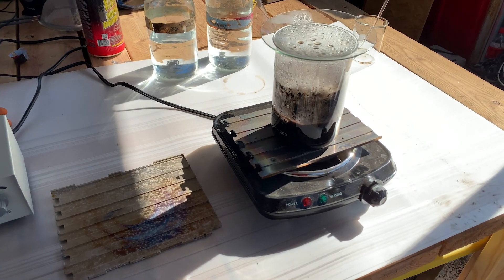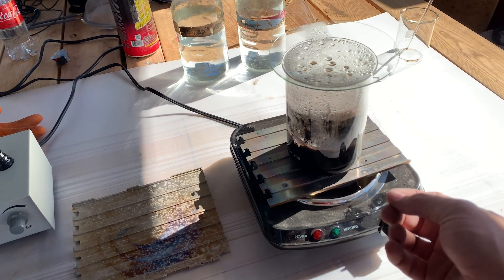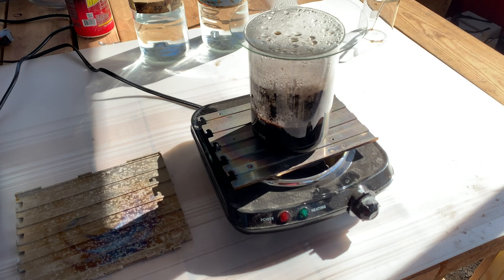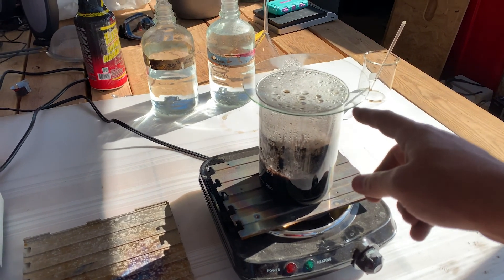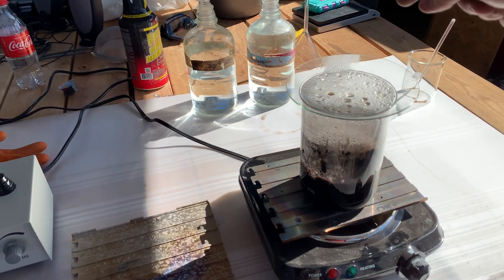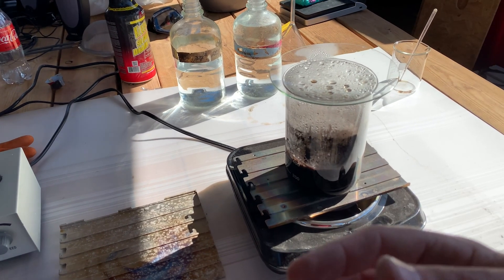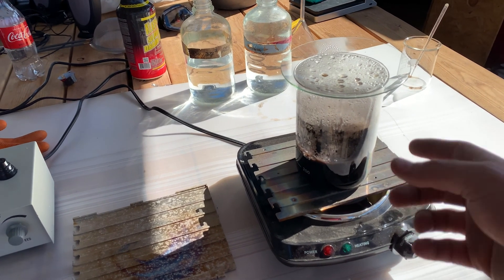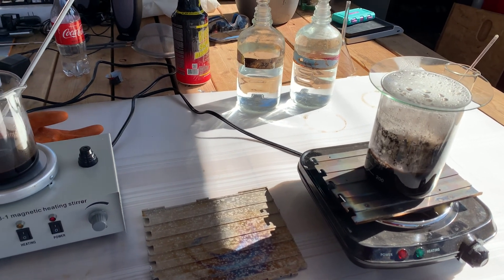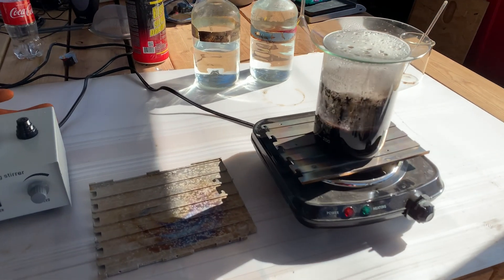This stuff builds up enough pressure that you can hear it popping once in a while. You can see the dark liquid up on top where it has exploded up and collected on the bottom of my viewing glass. Just know that when you put these viewing glasses on top, you're increasing the pressure — on the beaker that only has that small little opening, the pouring spout, you're creating a bottleneck and it creates pressure inside. So just be very careful, wear your safety equipment, wear your goggles to protect your eyes.